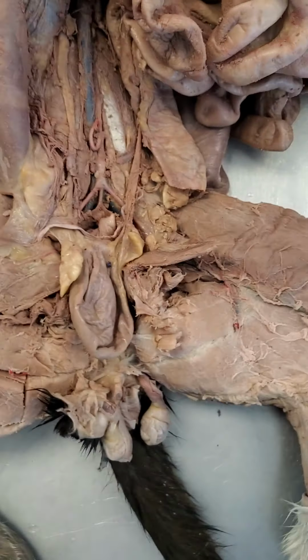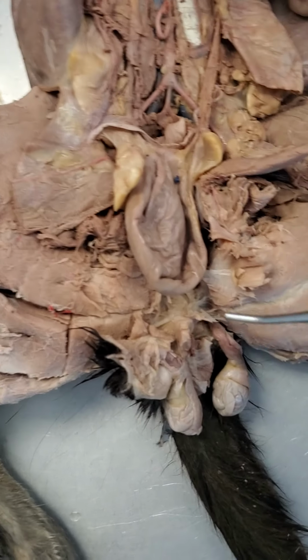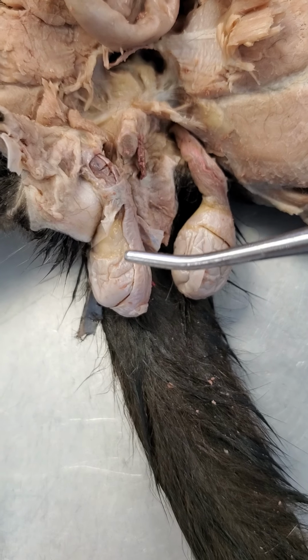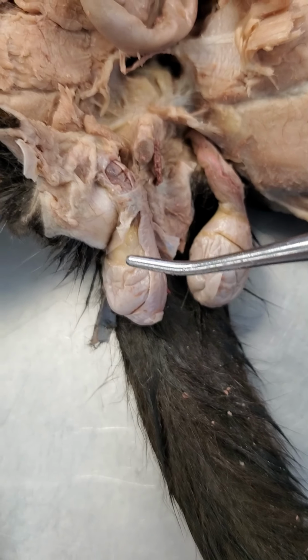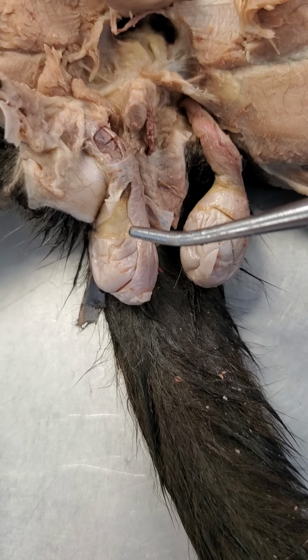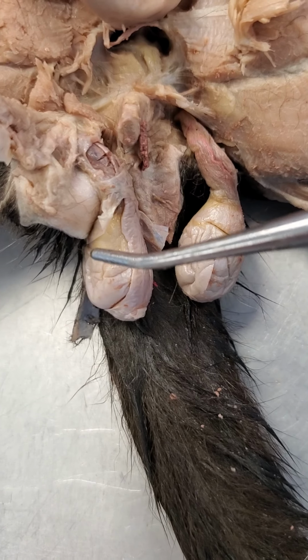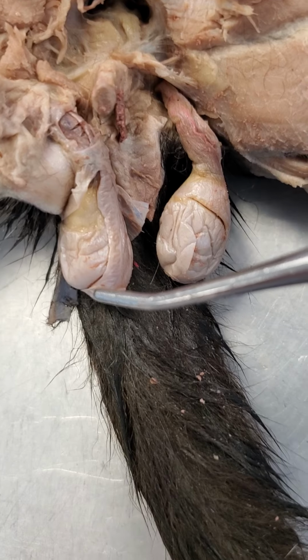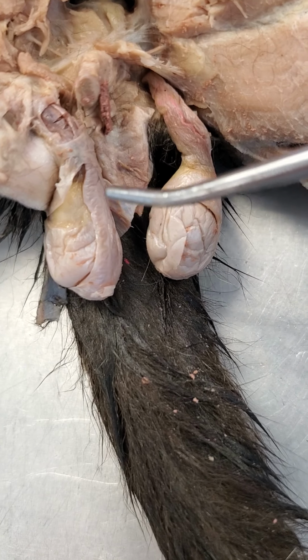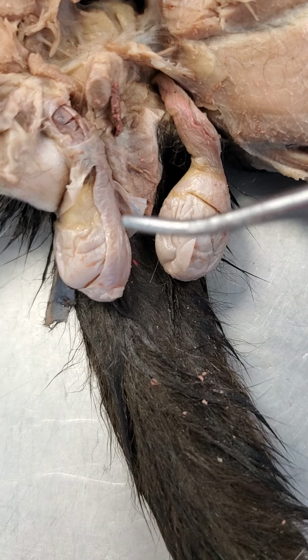All right, so if we switch gears to the male cat, we can see, of course, the two testes here. And this is actually a really nice view because what we can see is this is a testis right here on the other side of the probe. So this is the testis, this is where sperm production is initiated. And then you can see the structure right here that's kind of wrapping around the edge. This is the epididymis, and this is the site of where sperm is maturing.